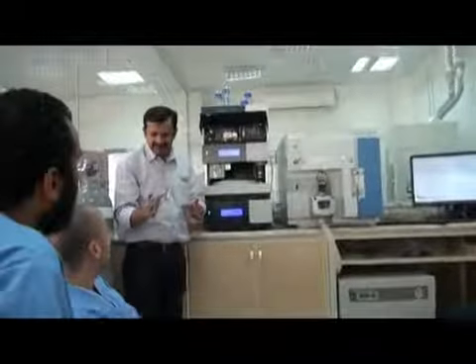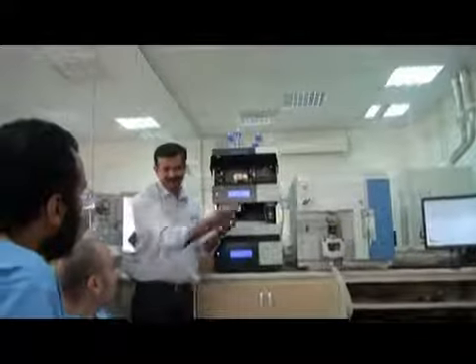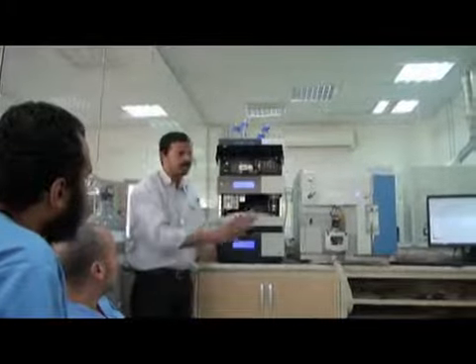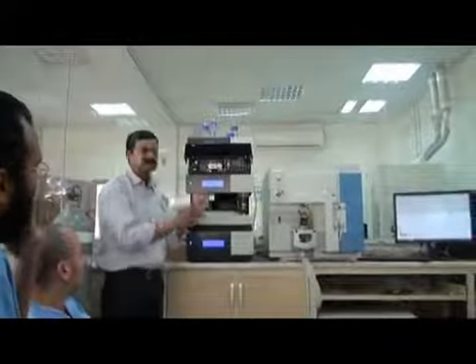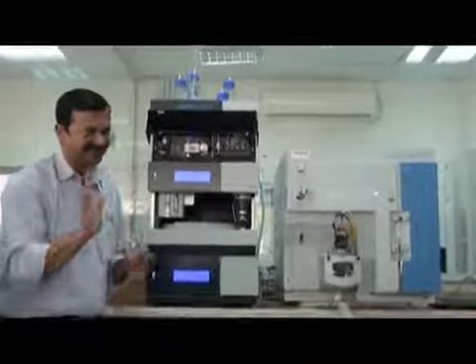Okay? Please, if you have any question, don't be shy, ask him, he will tell me, or he will answer, or I will answer, no problem. But you have to understand, if you really want to work with the system, then you have to understand how it works. There is no shortcut here.